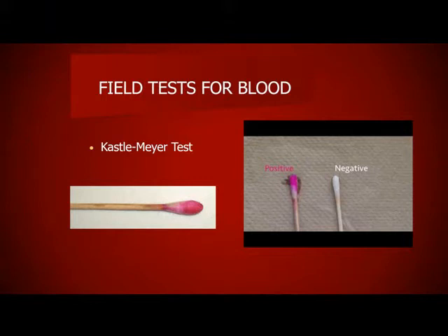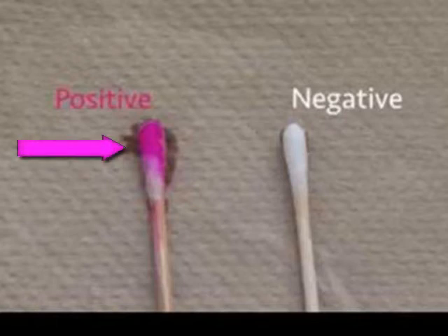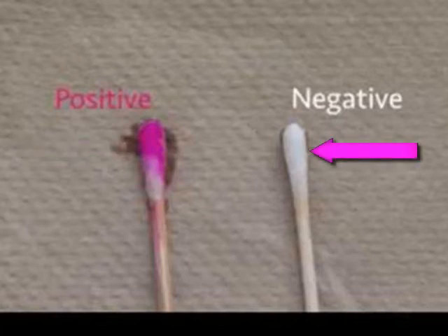There are field tests for testing blood outside of the lab. The Kastle-Meyer test is a presumptive or screening test to determine if a substance is blood or is not blood. Phenolphthalein, which is a color indicator, is mixed with hydrogen peroxide, which combines with the heme in the blood. If the test is positive, it gives a bright pink fuchsia color and no color at all if the test is negative, as seen in the picture.